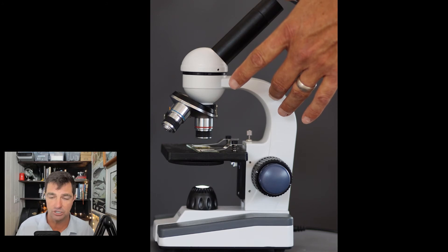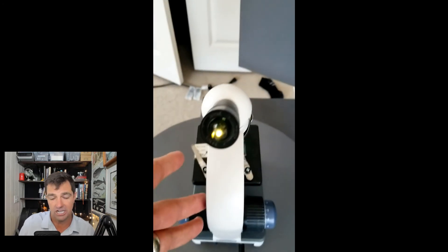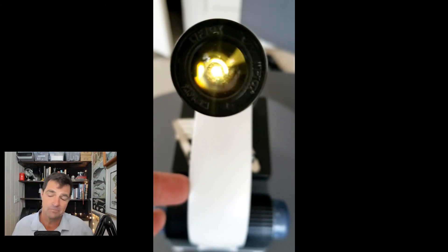What I've learned to do is put one hand on the microscope to stabilize it, hold my phone in the other hand, and use my other fingers to stabilize the camera.